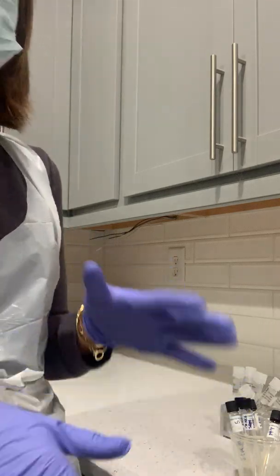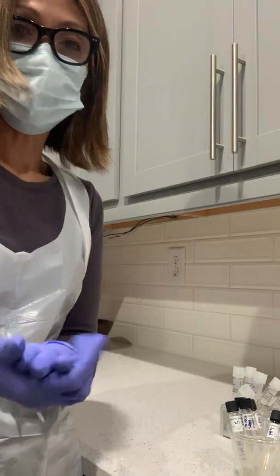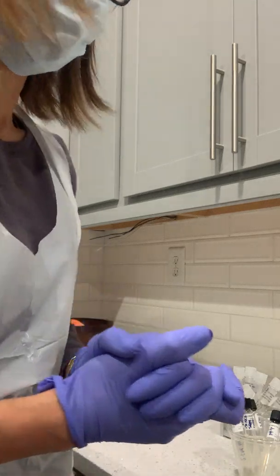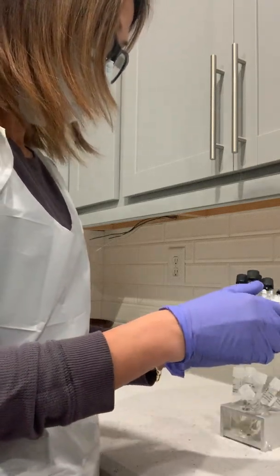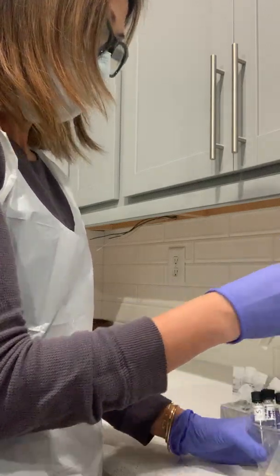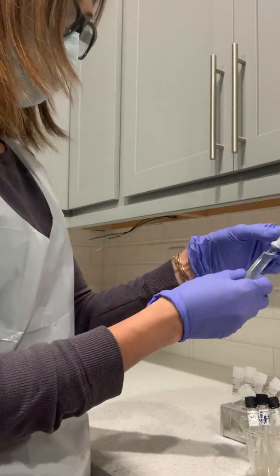So you can adjust the pH, but we're not doing it here.